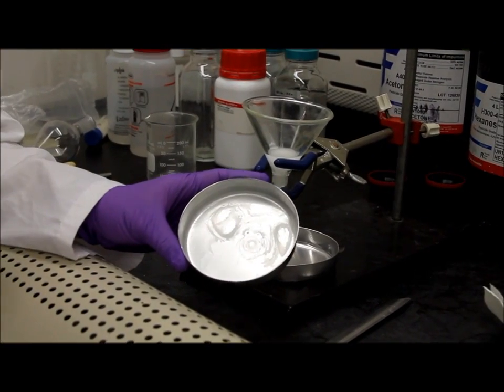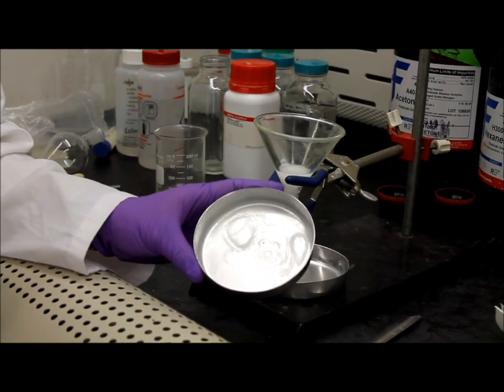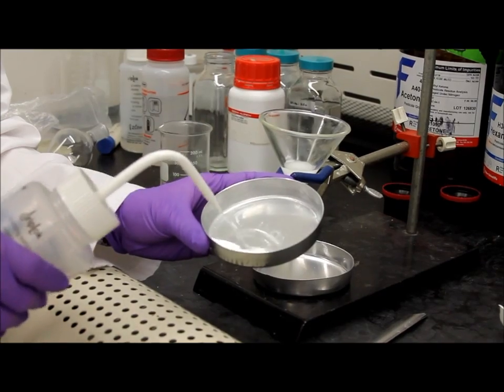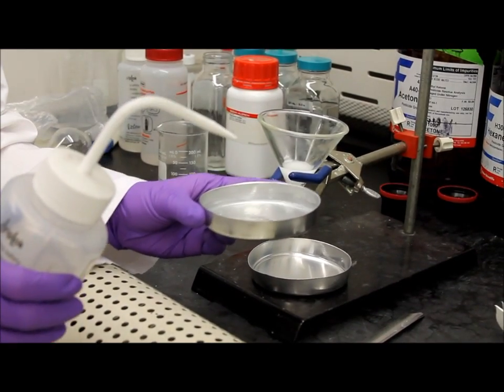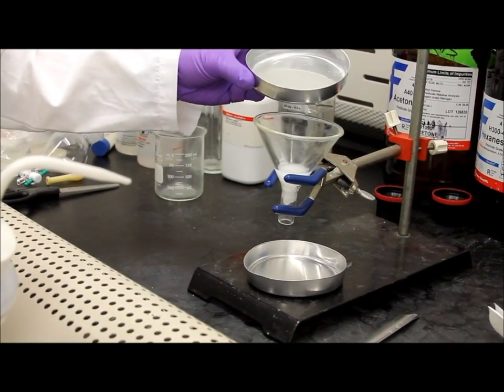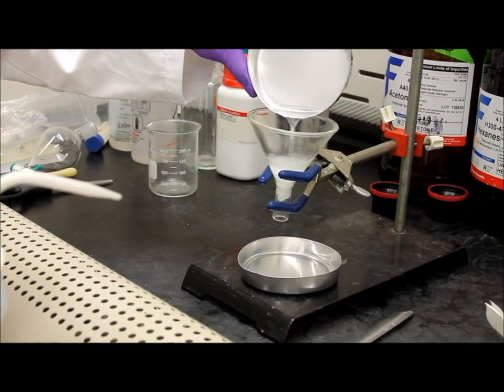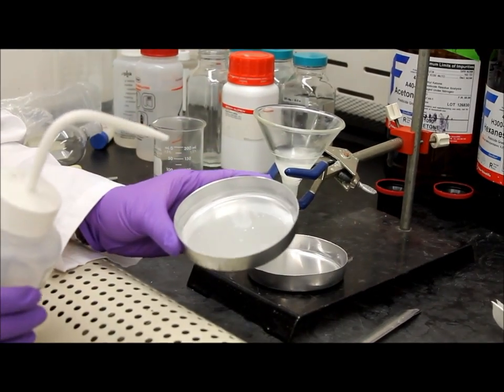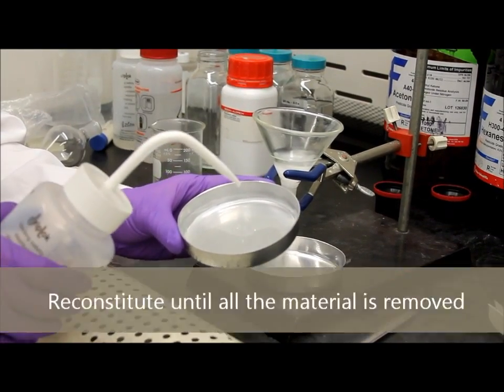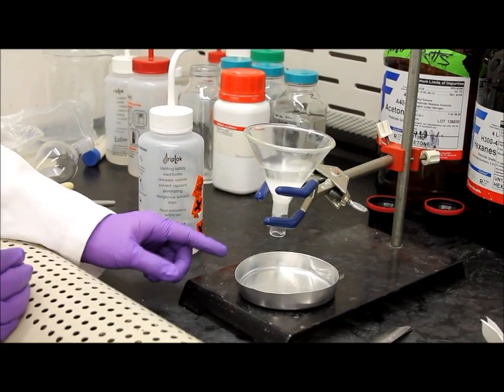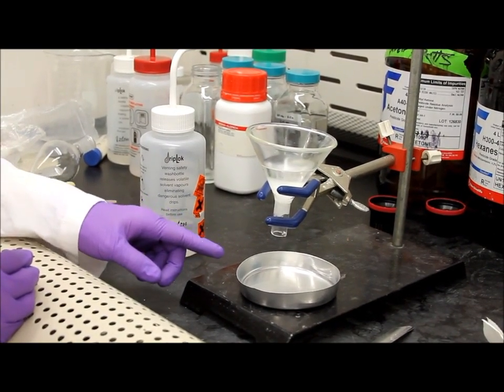To obtain your SGTHEM value, you want to reconstitute your previous pan with hexane and pour this solvent through your silica gel funnel. Repeat the reconstitution step three more times. This solvent will drip into a pre-weighed clean pan below.